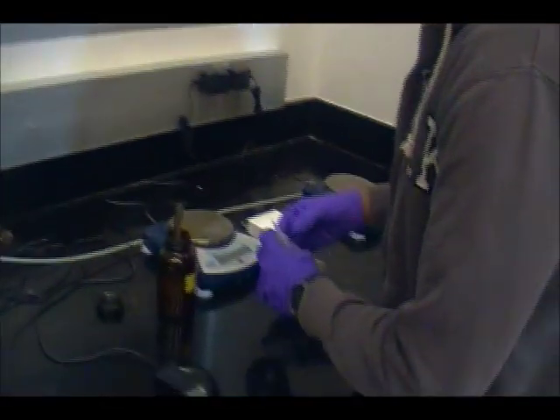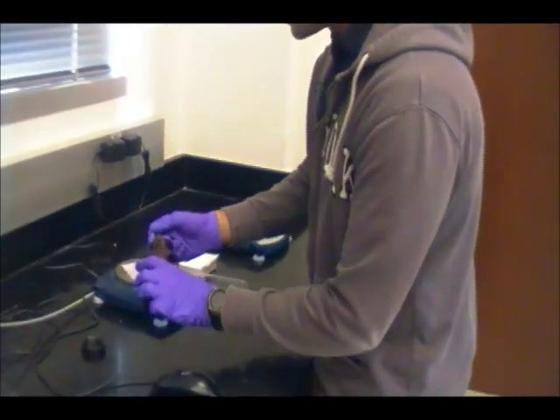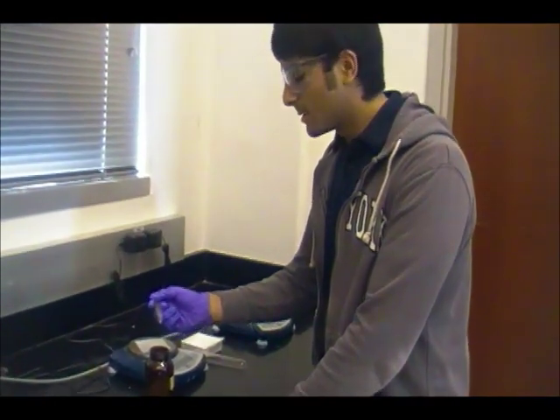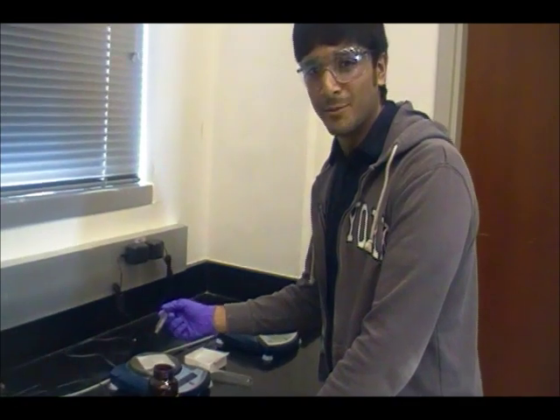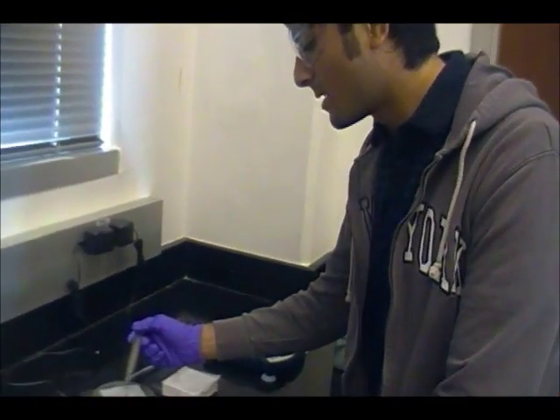for chemistry. The first step that we need to take is to measure 0.14 grams to 0.16 grams of magnesium. And it's important that we measure within this range because using too much magnesium can cause too much hydrogen gas to be produced. Using too little magnesium can cause too little hydrogen gas to be produced. And it's not really that bad if you use too little magnesium, because you can still accurately do your experiment, but you have to measure a greater correction value for your pressure. But you definitely shouldn't use more magnesium, because that will overfill the graduated cylinder that you're using to measure the hydrogen gas's volume.